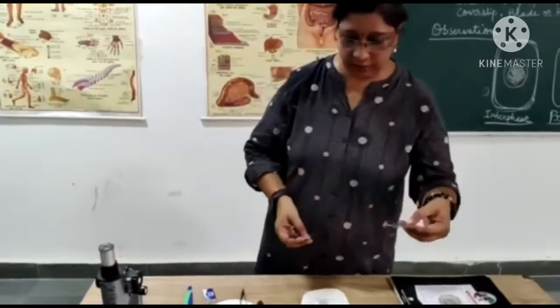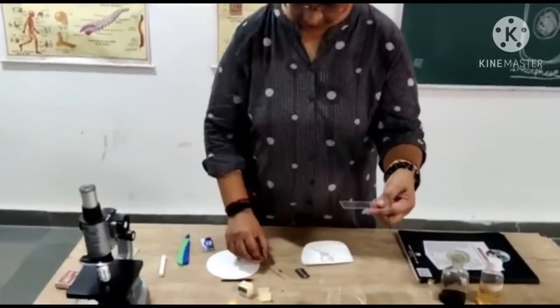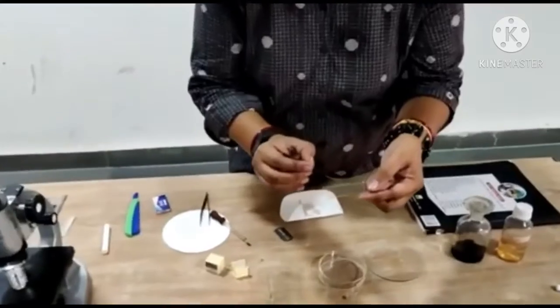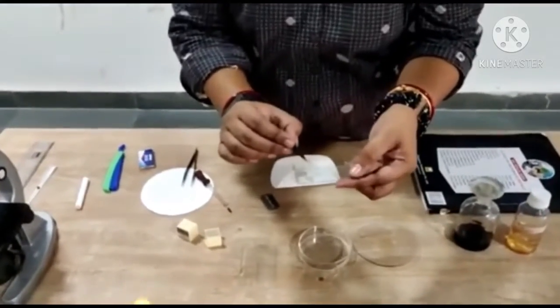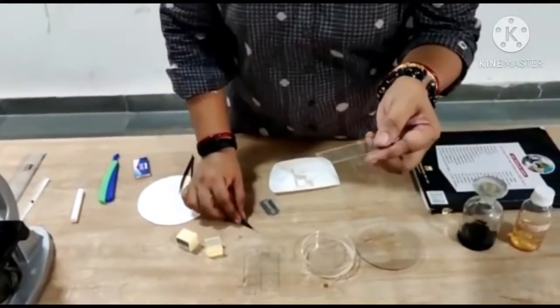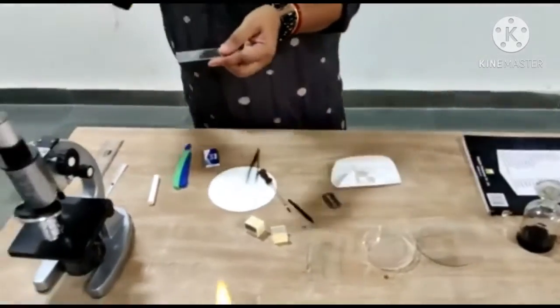It also will absorb the excess staining. This is the material. After preparing the slide, observe under microscope.